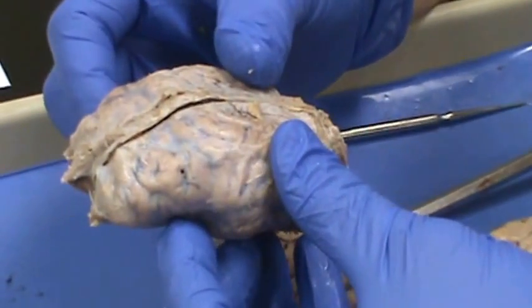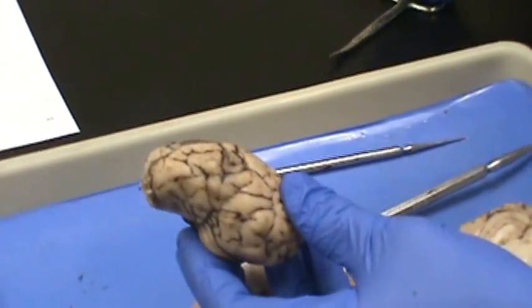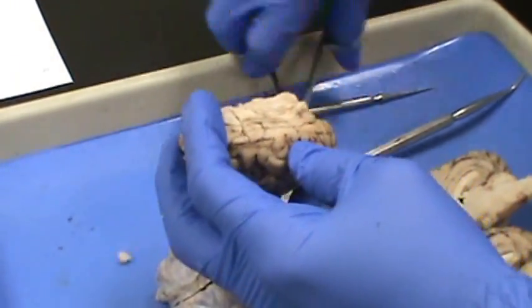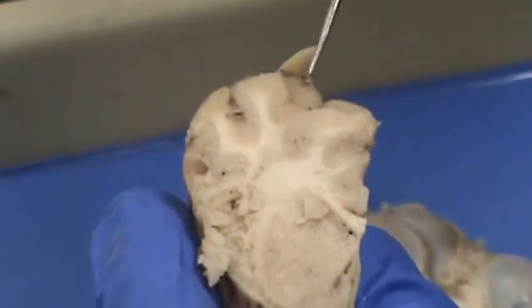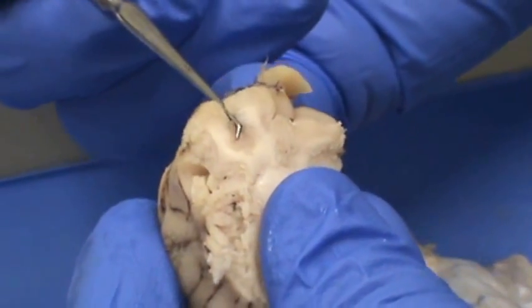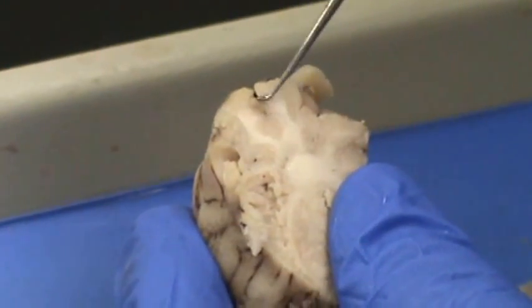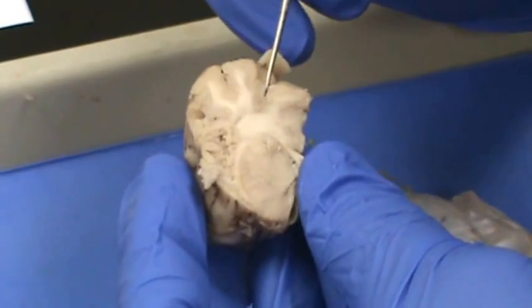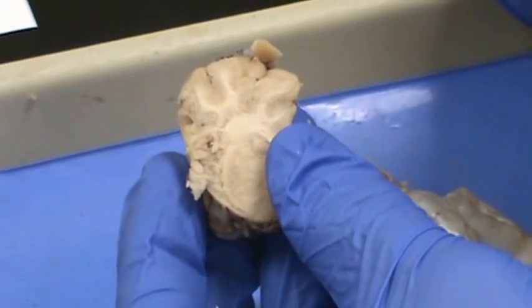If we look at the cerebrum, you have the outer 2–4 millimeters of the brain being the cerebral cortex. We're going to do a frontal cut, and whenever you open it up, you see that you have light on the inside and darker areas on the outside. The darker areas line the wrinkles — the sulci. So here you have the white matter, and here you have the gray matter. That gray matter on the outside part of the brain is called the cerebral cortex.